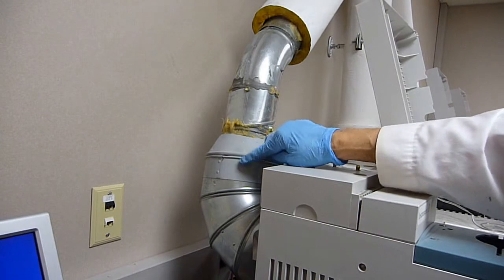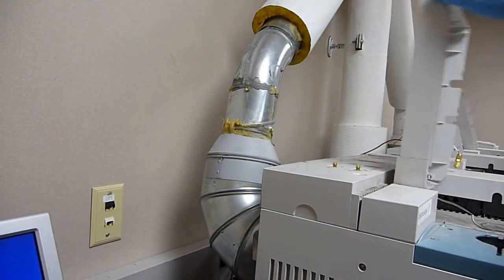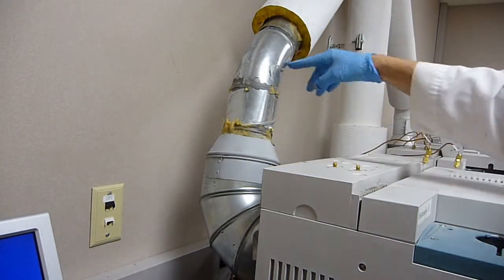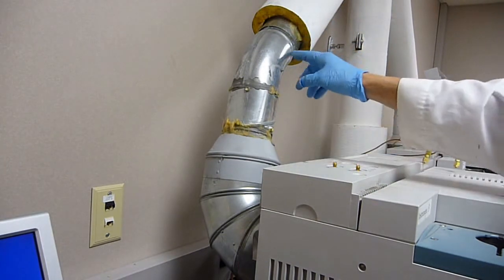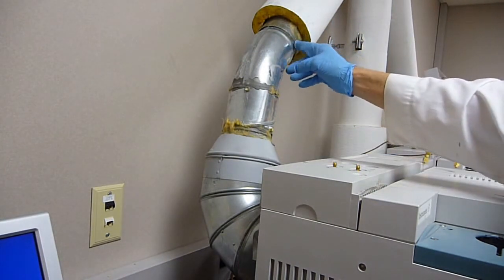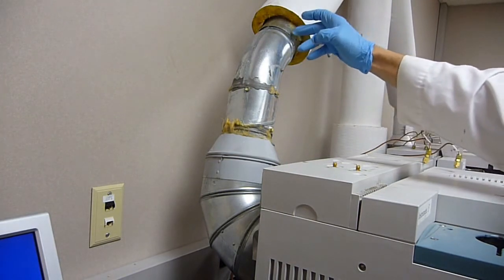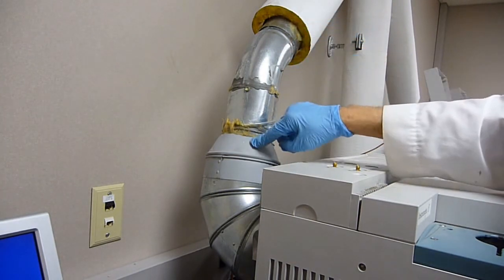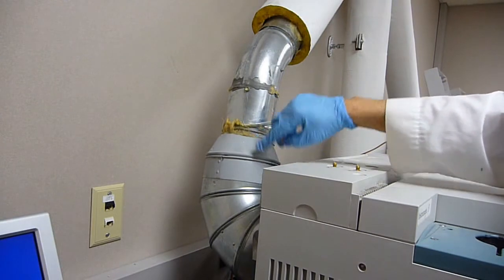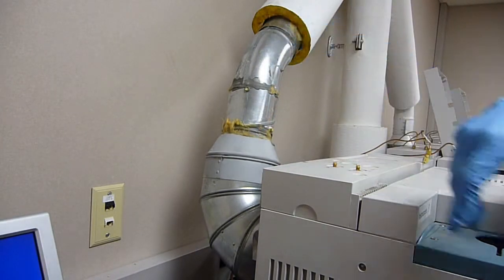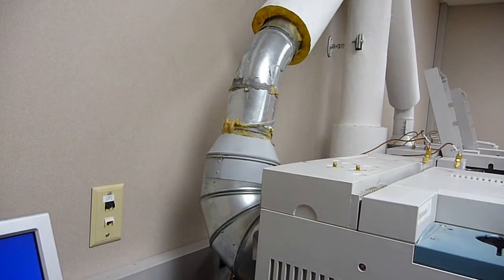I don't really like this setup. I'm going to change this to an open split by adding a four-inch to six-inch adapter and having an air gap. I don't like to have the suction pressure on oven flap doors.